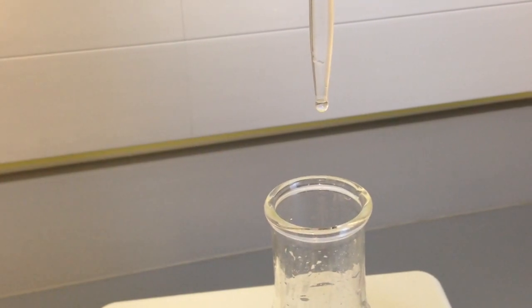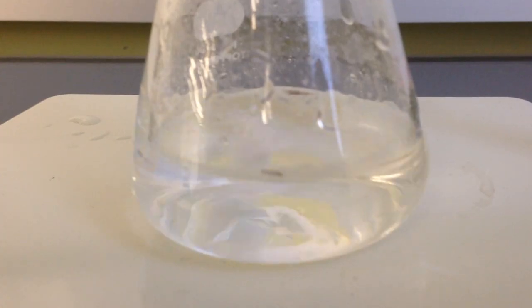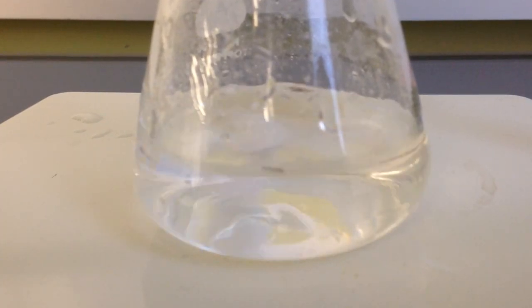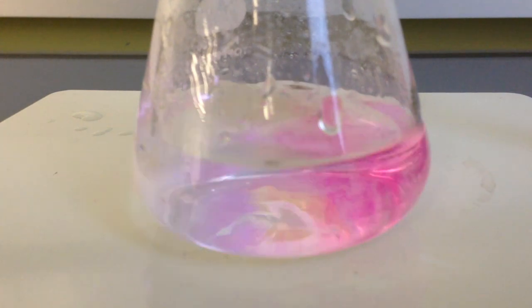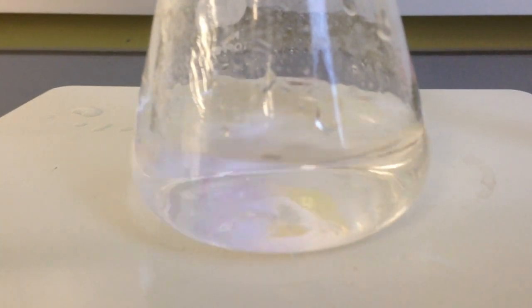To do so, add the titrant drop by drop. Leaving time between the drops is best in calculating the closeness to the endpoint. It's best to count how long the indicator lasts between drops.